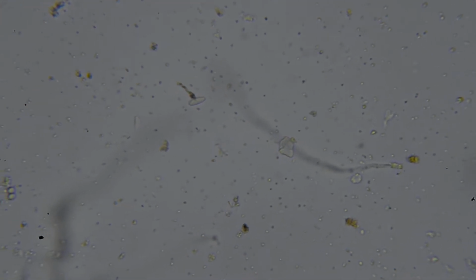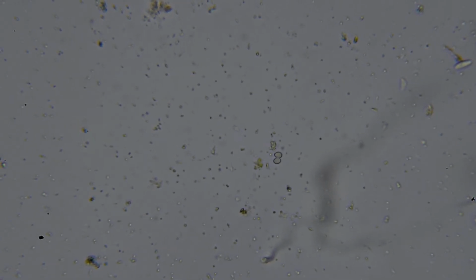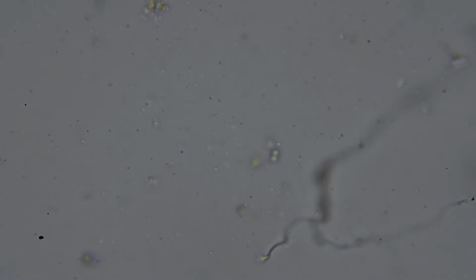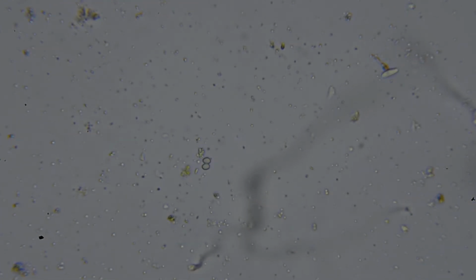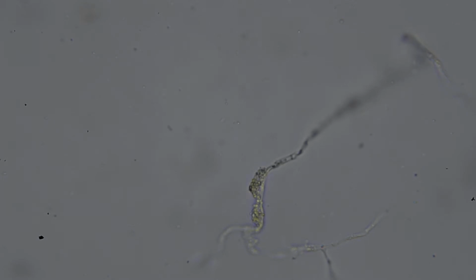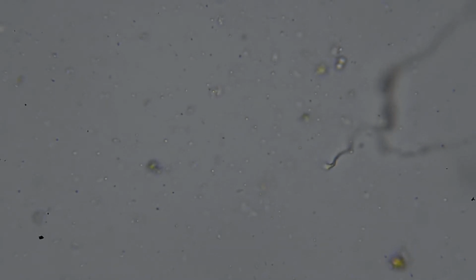So I think it comes in from the top right to the bottom left at some point, but I think I paused to see it. It's very, very fast moving. And that's a pathogen. So it's a pathogen for humans, it's a pathogen for plants. There's obviously many species of spirilla and spirochetes, but they can be quite nasty, but only in large quantities. Seeing a singular individual is not really anything to worry about particularly.